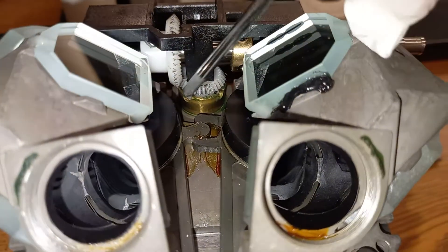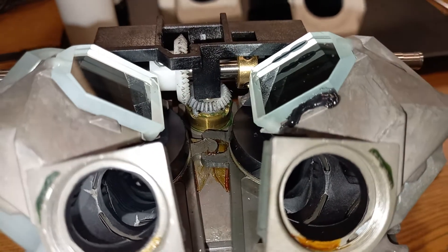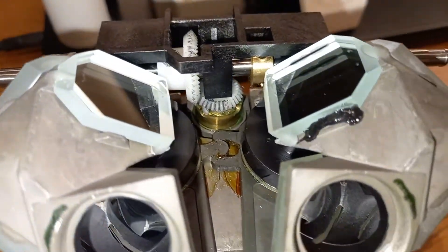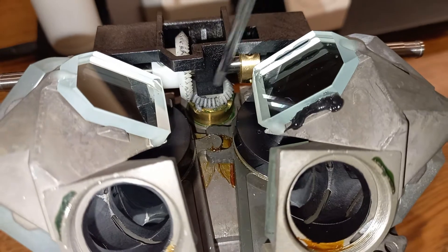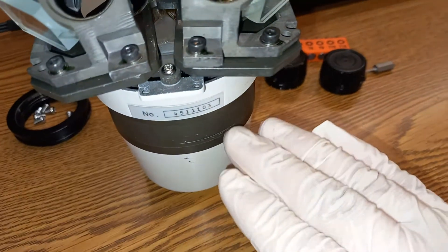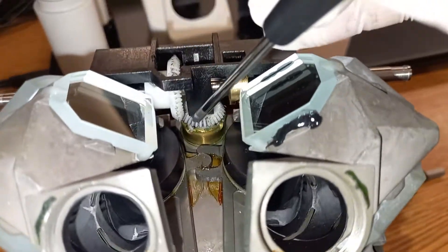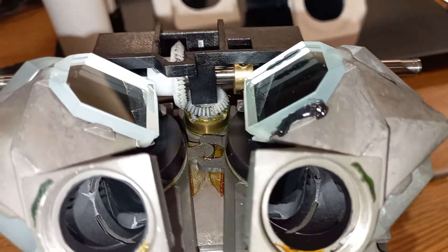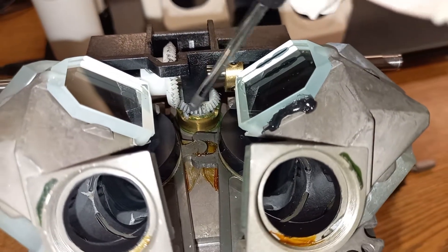Here we are — the inside of this microscope. These gears right here are made of nylon. The reason why I'm taking this apart is I wanted to repair this microscope, and I have repaired it. Basically, this bottom shaft is meant to rotate left and right, counterclockwise and clockwise, in order to adjust the optics inside of this housing.